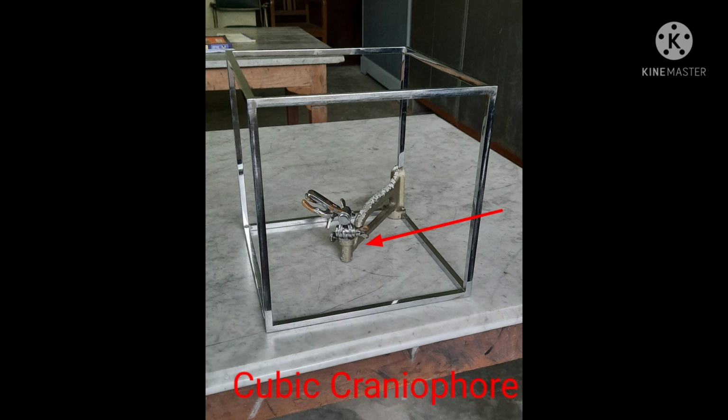The skull is fitted with the skull holder at the foramen magnum. The holder is then fitted in the center of the craniophore. Its proper orientation is done with the help of a horizontal needle. In this manner, any desired aspects of the cranium can be drawn with the help of a diagraph.